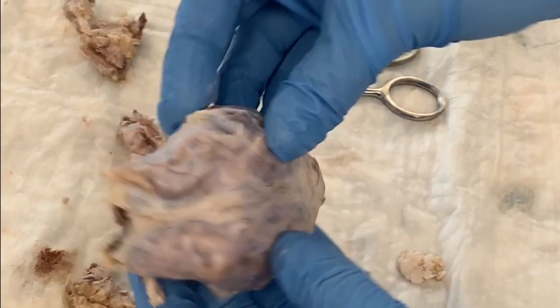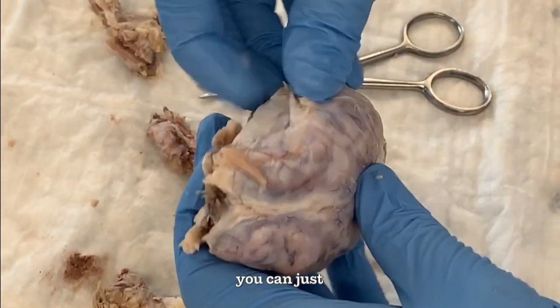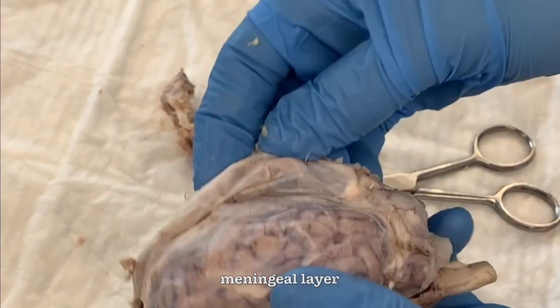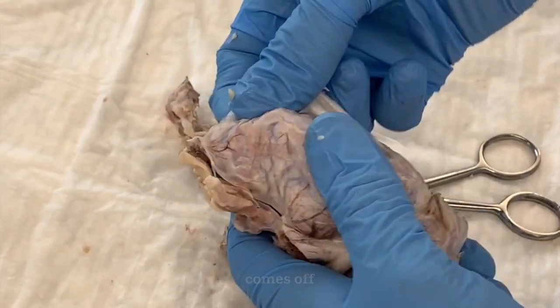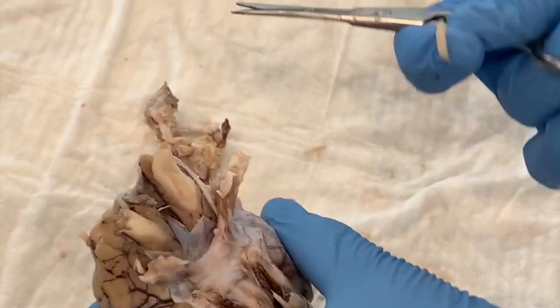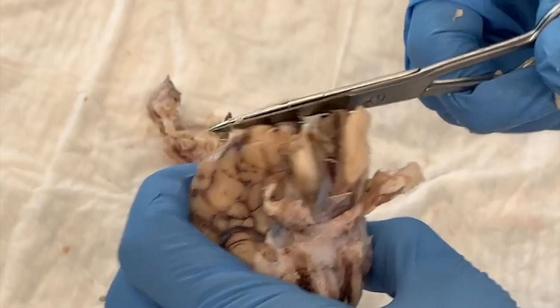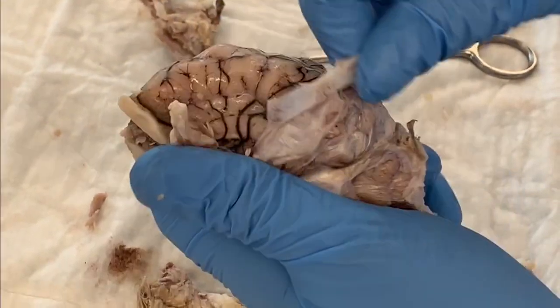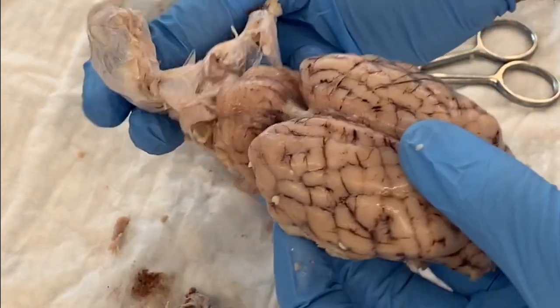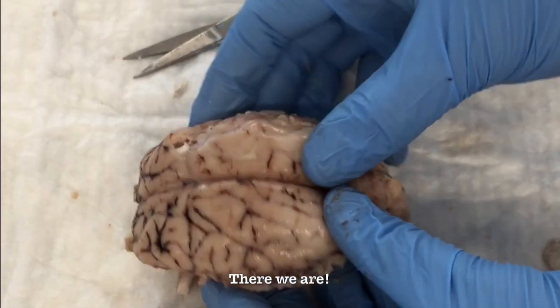Okay, now you can just peel off this entire meningeal layer, and you see it just comes off like a cap. There's one more spot. Right, there we are.